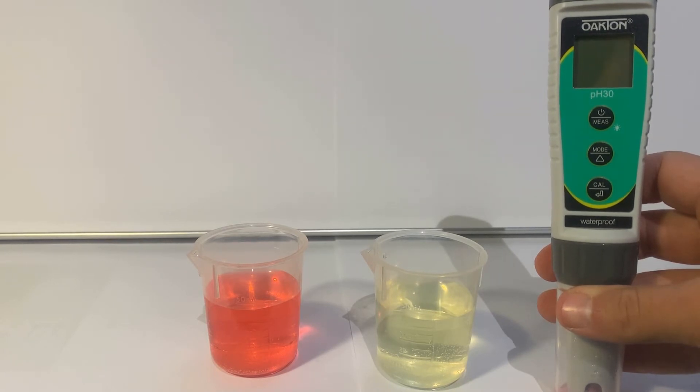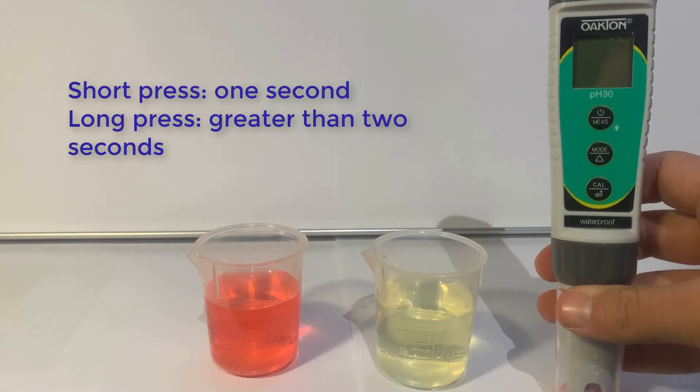We will be using the long press and the short press on the buttons today. A short press is a quick one-second press, and a long press is holding the button down for about two seconds.